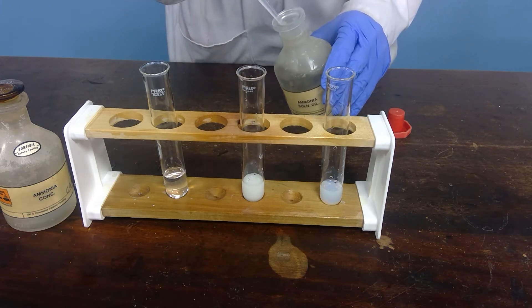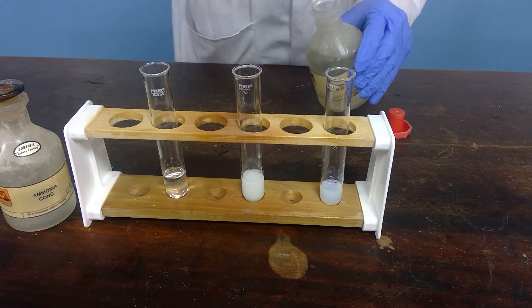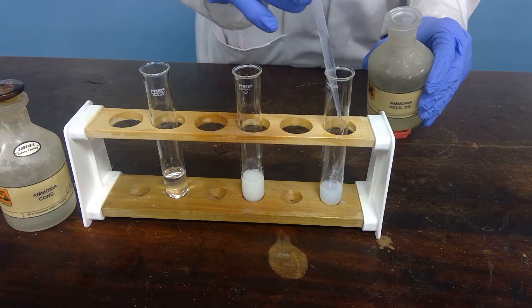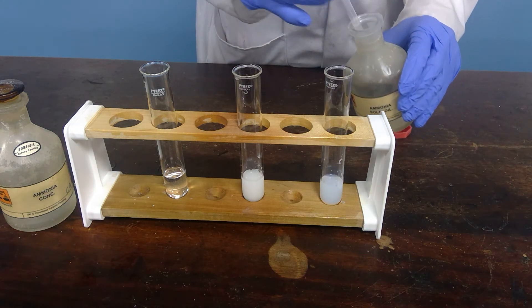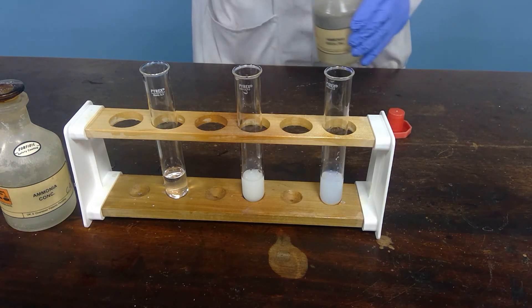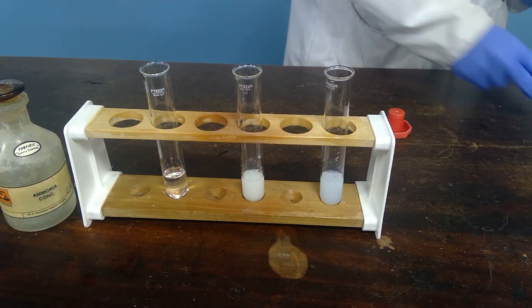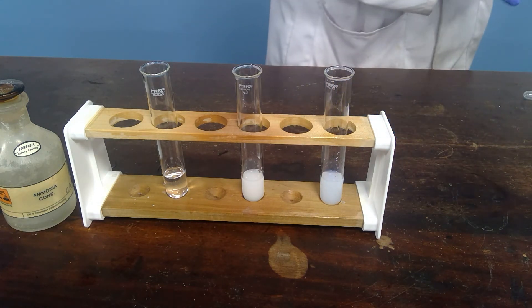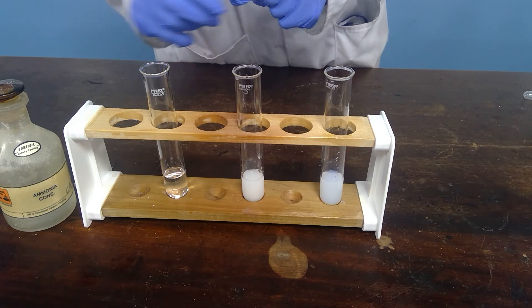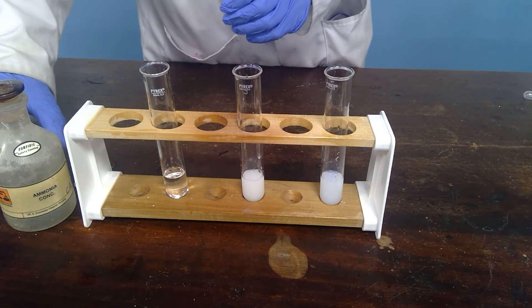The bromide does not. And the iodide does not. So we have distinguished the chloride, because silver chloride dissolves in dilute ammonia solution.